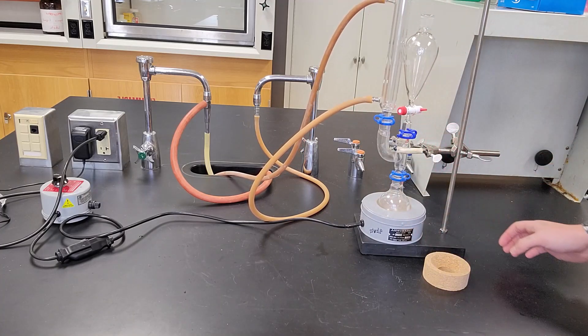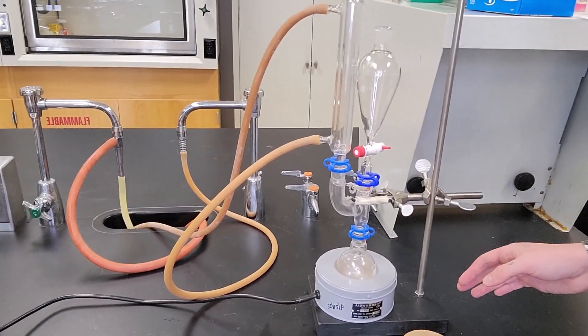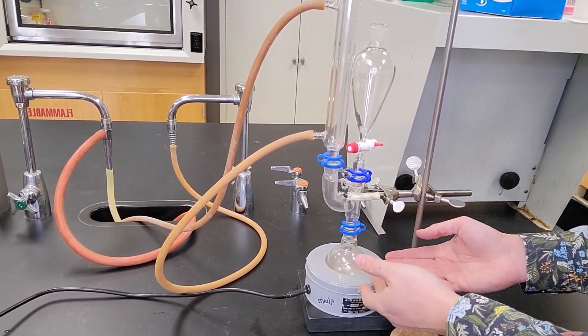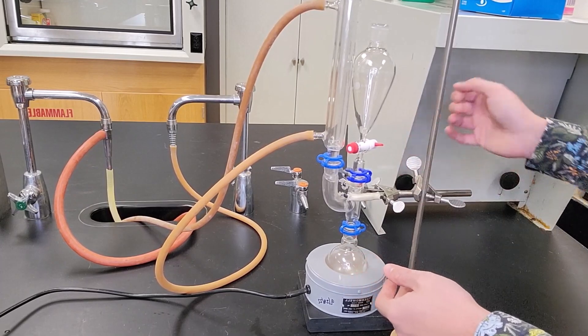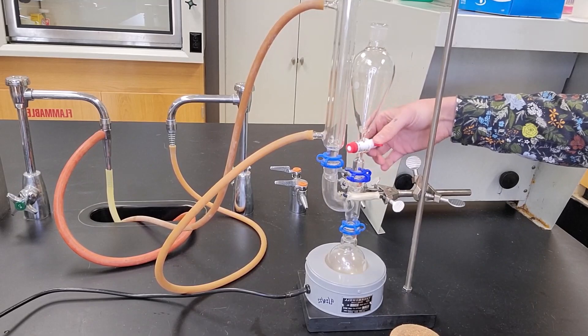So now what we have is our total setup and I'll bring you a little bit closer so you can see. We have our reaction flask, which if we would need to heat it, we would heat it. We have our addition funnel, which I can control how fast it adds by how far open it is.